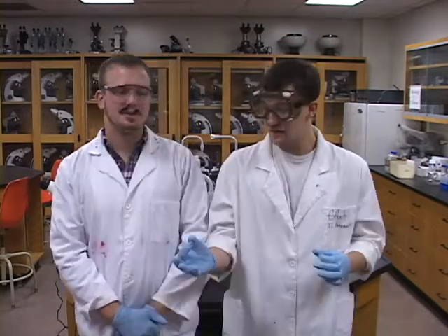Let me just ask you a question, Patrick. Do you know what the gram stain is used for? I do know what the gram stain is used for. What's the gram stain used for then, Patrick? The gram stain is the most useful differential stain used in microbiology. It is? It is. This is interesting, Patrick.